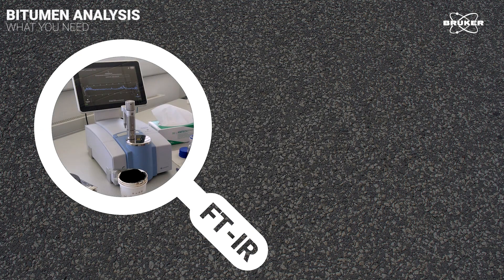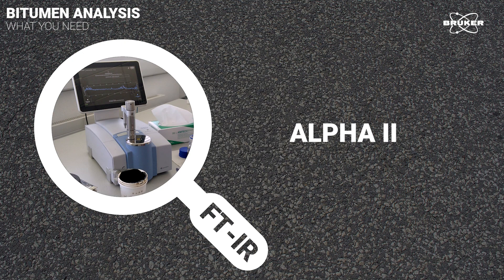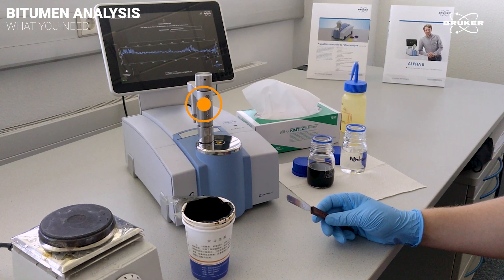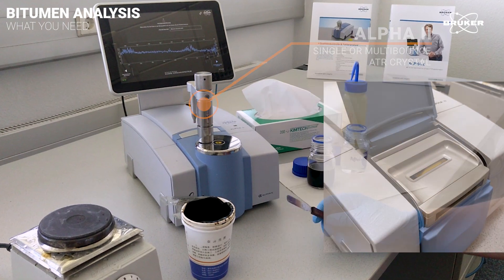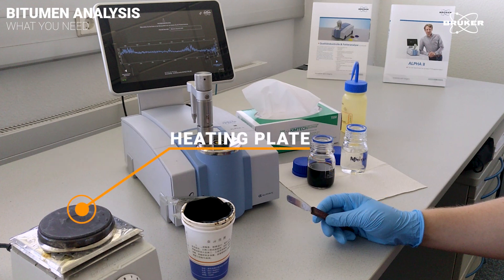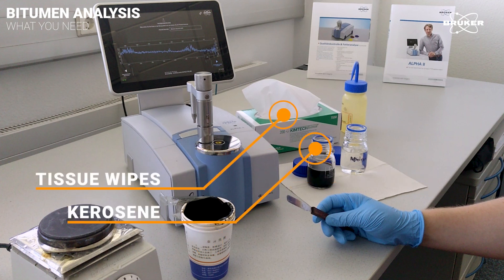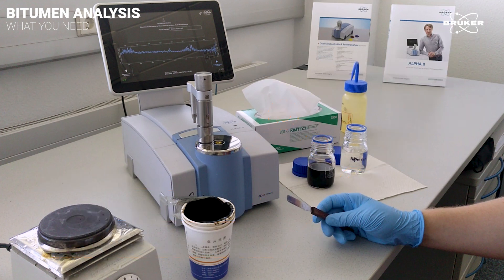Let's take a closer look at how the Alpha-2 FTIR Spectrometer is used for bitumen analysis. To begin, make sure that everything you need is by your side. You will need the Alpha-2 with a single or multi-bounce ATR crystal, gloves, a spatula, a heating plate for heating the spatula, the bitumen sample, soft tissue wipes, kerosene, and isopropyl alcohol. Don't forget to assure good ventilation.